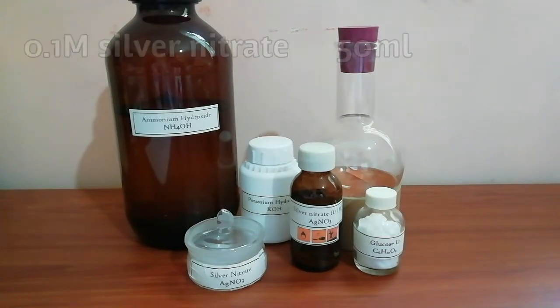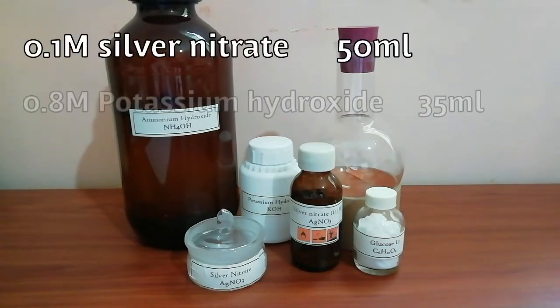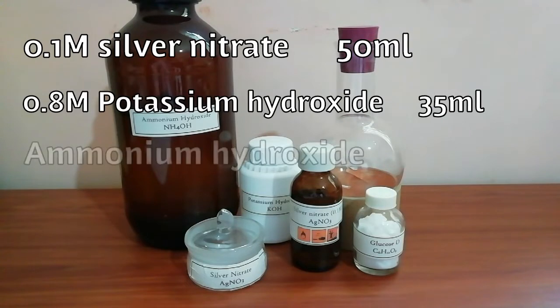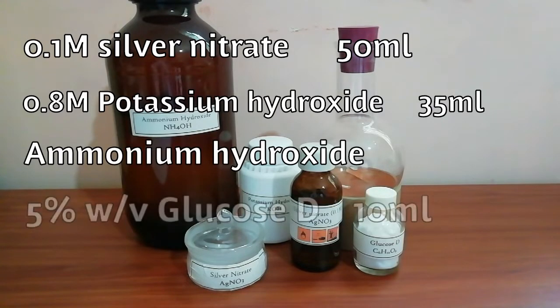For this reaction we need 0.1 M silver nitrate solution, 0.8 M potassium hydroxide solution, ammonia solution, and 5% glucose solution.